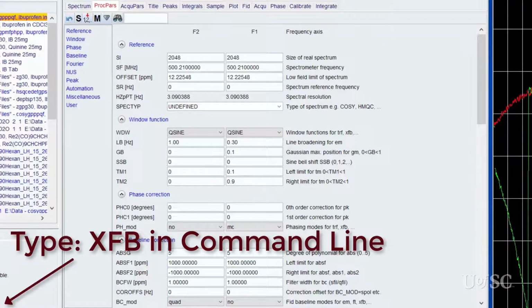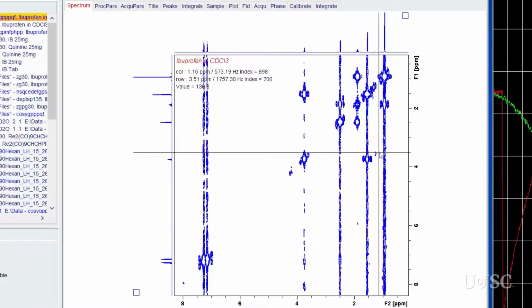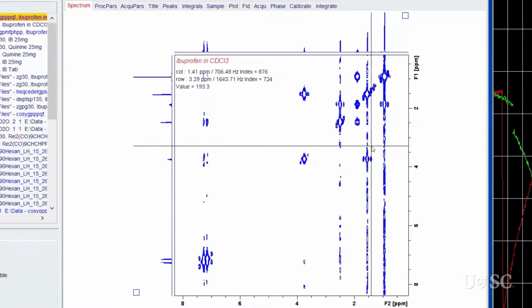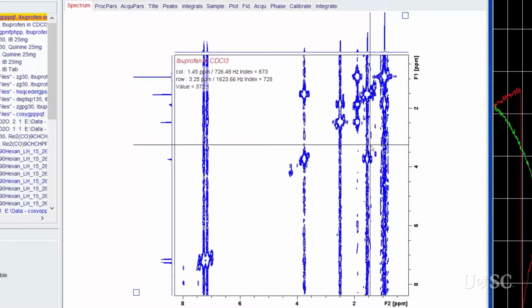Then we can reprocess both axes with the XFB command. The reprocessed 2D dataset will look more natural without the symmetrization process. However, if you blow up the intensity, you will see streaks of noise that travel down the data. This is called T1 noise and is produced by any instrument or sample instability during the run. Mostly it is due to having relaxation delays set too short for the spins in the sample. All 2D datasets will have some degree of T1 noise.